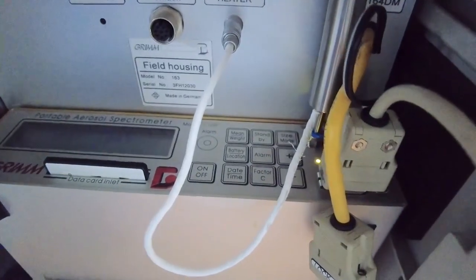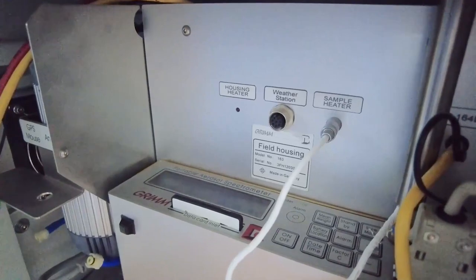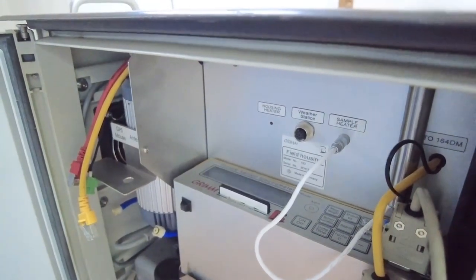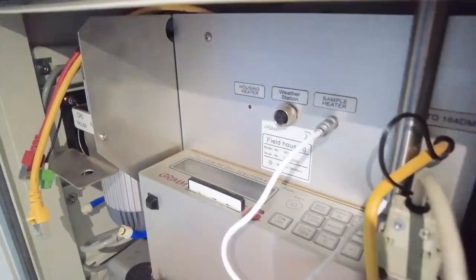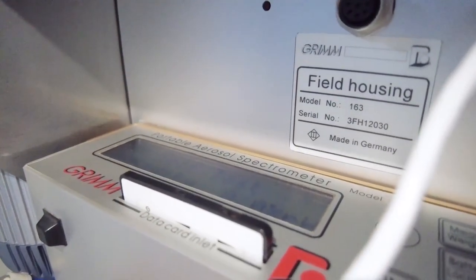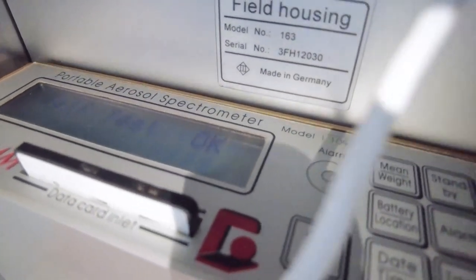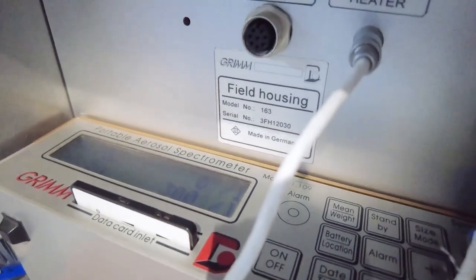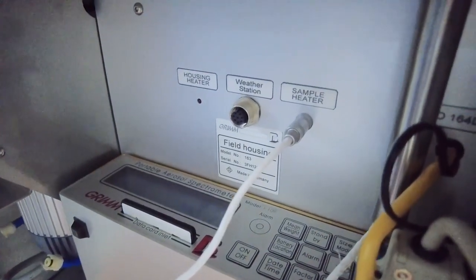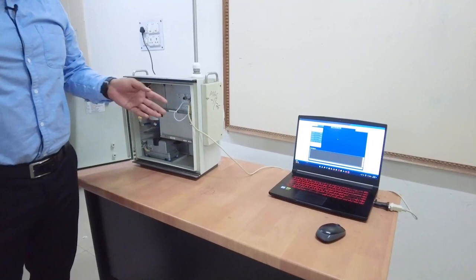After hearing the beep sound, the spectrometer goes into self-test, which lasts 30 seconds. After self-test, it will start measuring the particles and will show the counts per litre. In this spectrometer the units are in counts per litre. After self-test is confirmed okay, you can see PM10 and PM2.5 are being displayed. Now the spectrometer has started and we need to configure it according to our requirements using the system software.